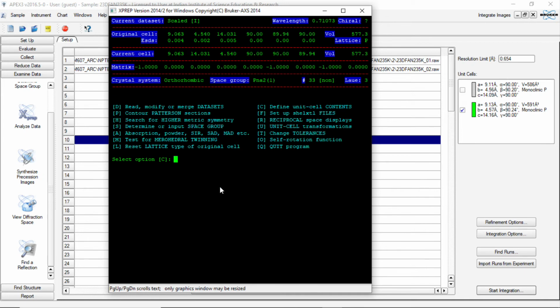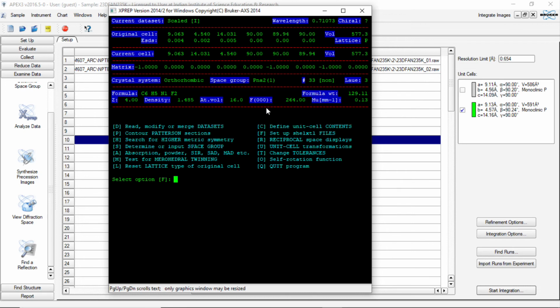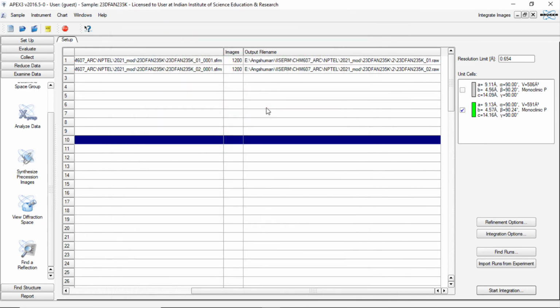So we come out of this and then determine and then incorporate the unit cell contents. Since it is difluoroaniline, we have C6, H5, N1, F2. Now, as usual, it generates the standard output file. We write it as 23DFAN235K, the name of the newly generated file. So now it has generated the new HKL file.